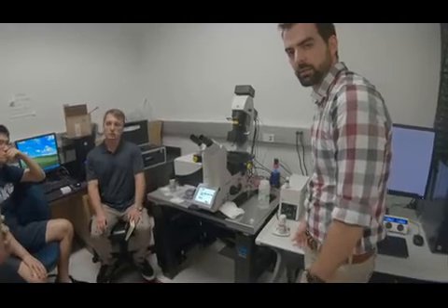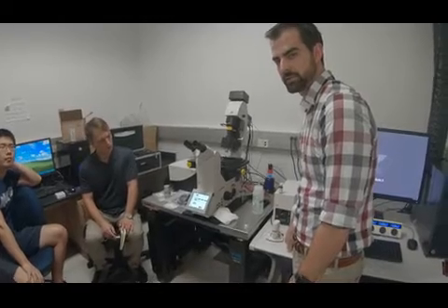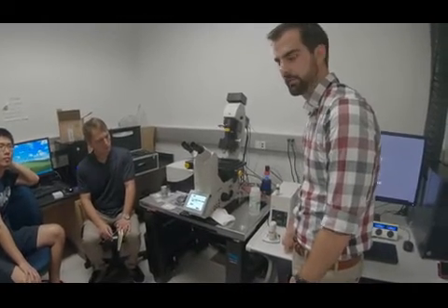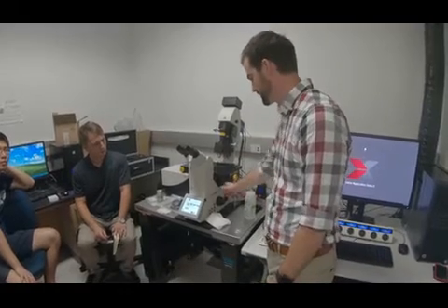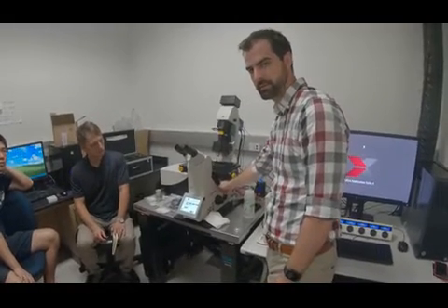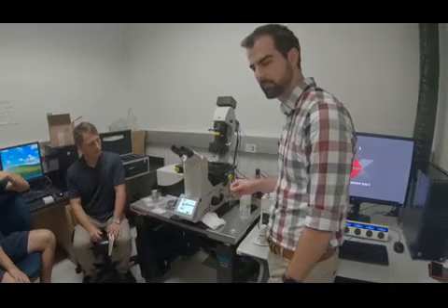Does the excitation objective have to pair with the detection objective? You have only one detection objective, which looks at the top. The excitation is on the stand, so it's a vertical light sheet. So how do you pair with the excitation?